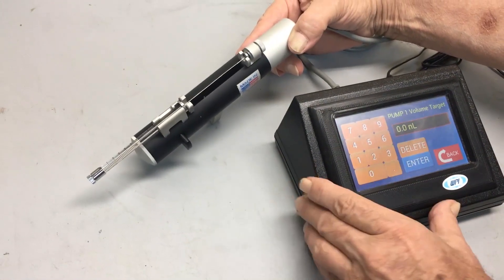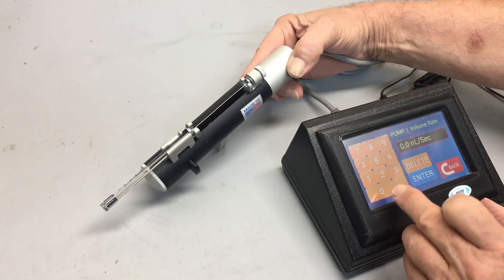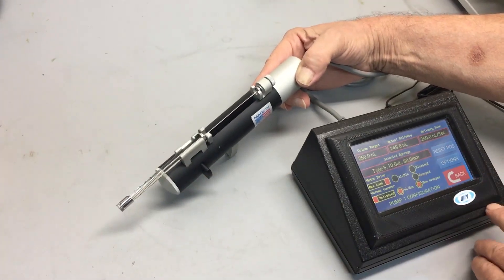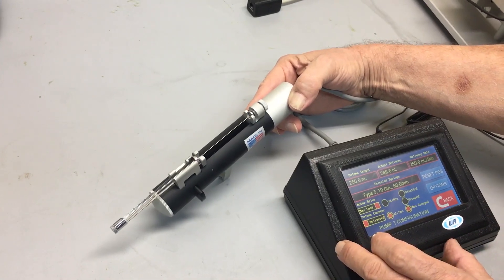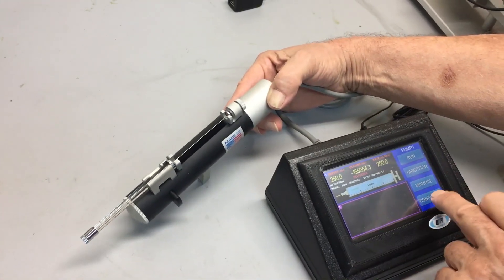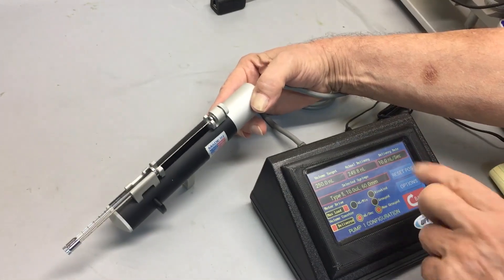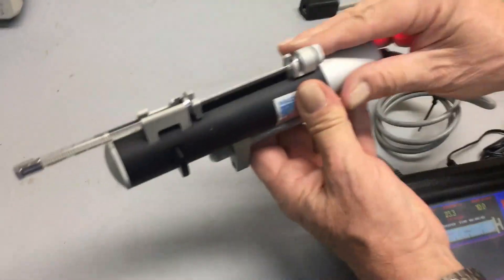Now let's say I want to inject 250 nanoliters at 10 nanoliters per second — like I want to inject a virus into a mouse brain. So configure: choose the right syringe, 250 nanoliters and a delivery rate of 10 nanoliters per second. Now I can go over here, change my direction to infuse and run, and the pump is running very, very slowly.